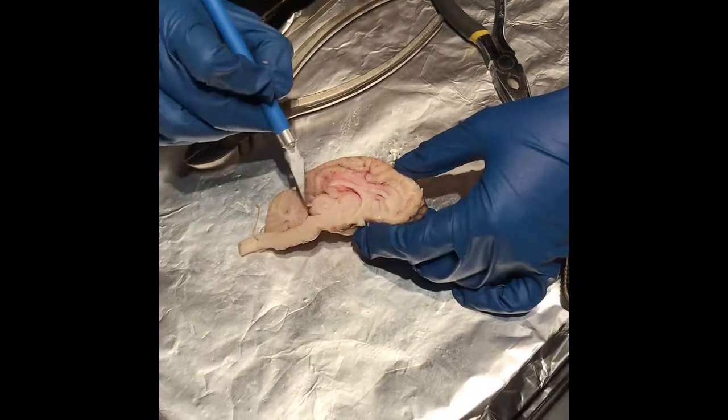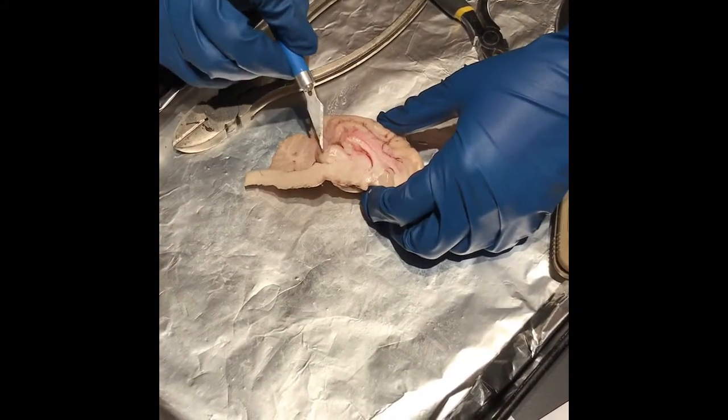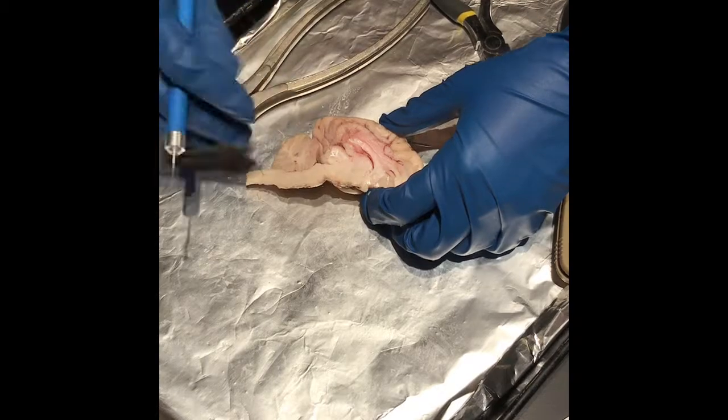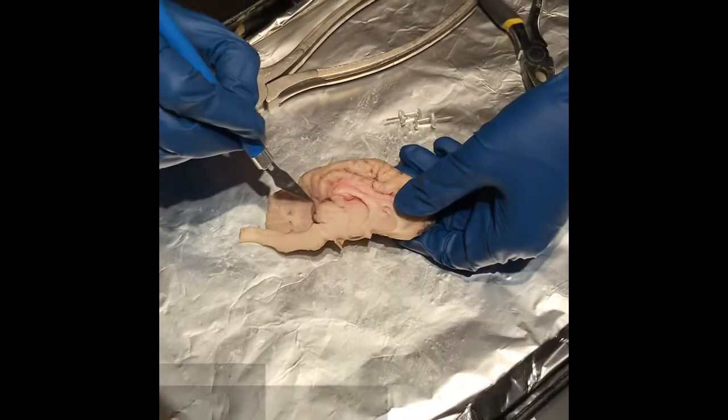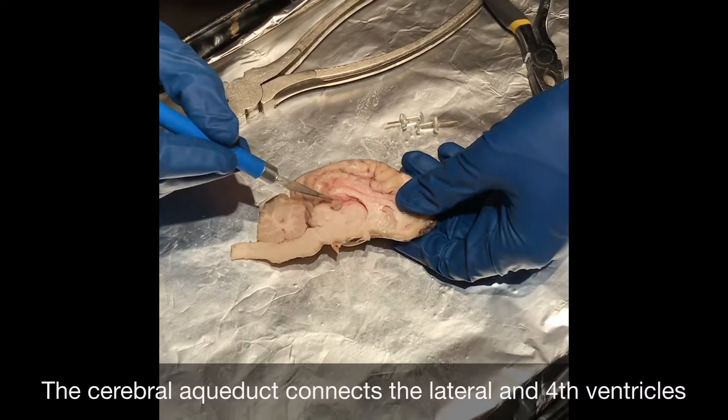That is the superior colliculus, actually. So superior colliculus right here, and inferior colliculus that we previously saw. The fourth ventricle is this area right here. You can see the cerebral aqueduct right in here.